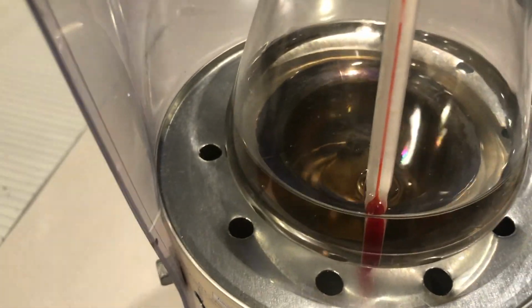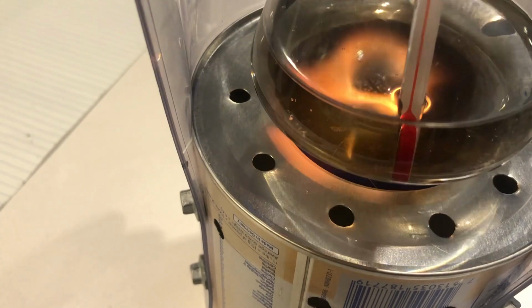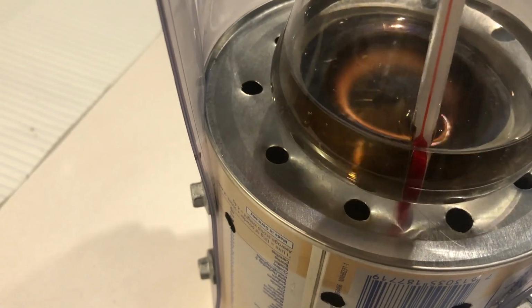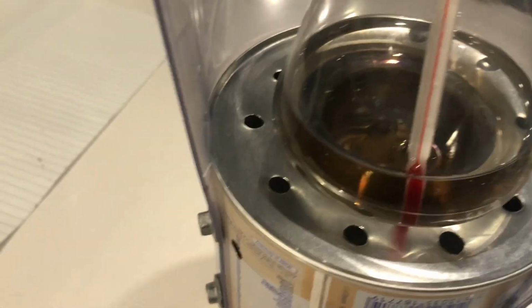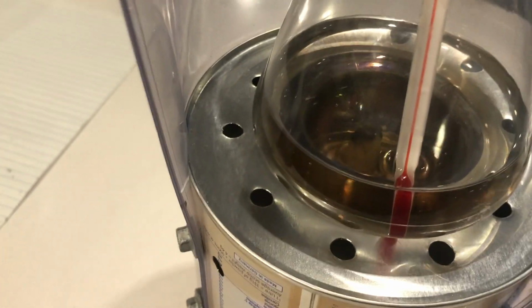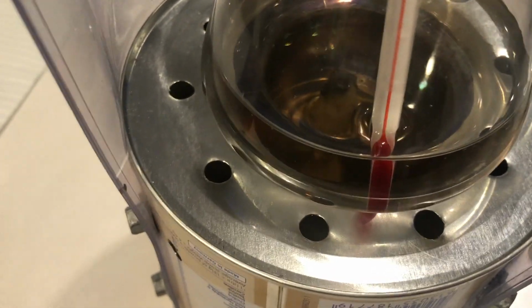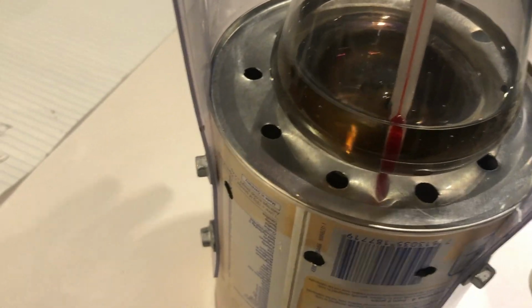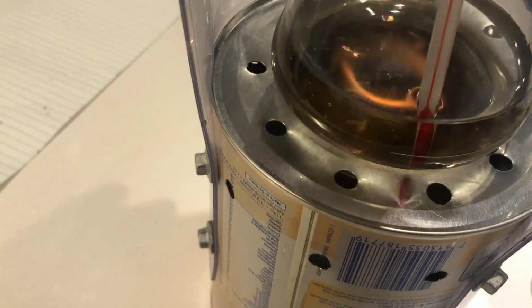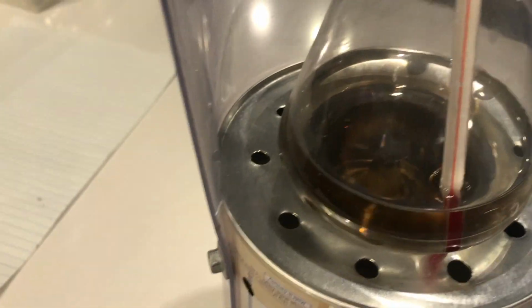We are assuming that the reaction type is complete combustion, and that's usually a blue clean flame where no carbon soot residue stays behind. If you are getting a yellow flame, it does signify that an alternate, different reaction is the one that's proceeding, and therefore you're not actually getting the delta HC for the reaction you expected. You're getting the delta HC for a different reaction. So we need to make sure that as best we can, we keep that flame blue, clean, completely burning, with very little soot residue of unburnt fuel.